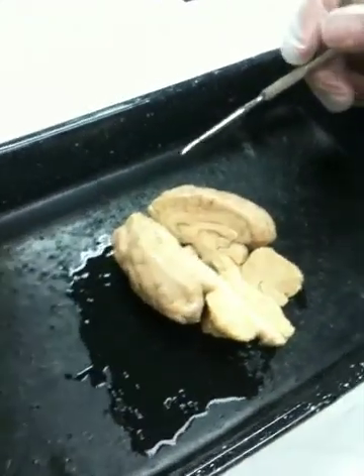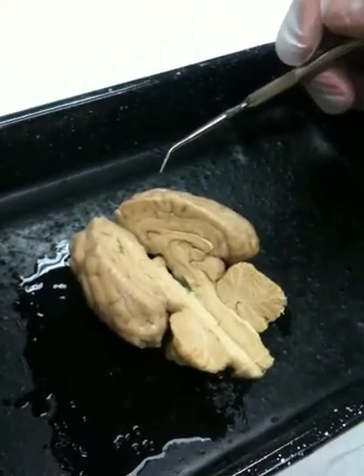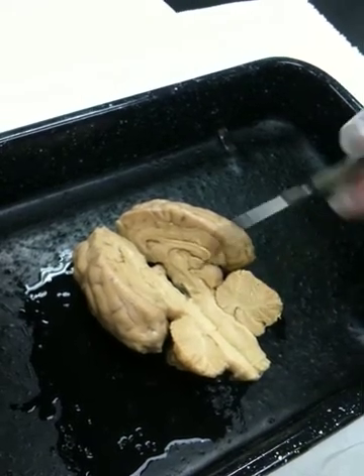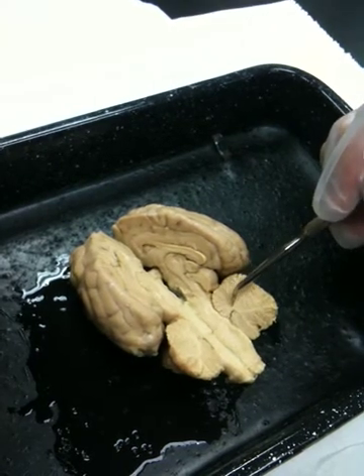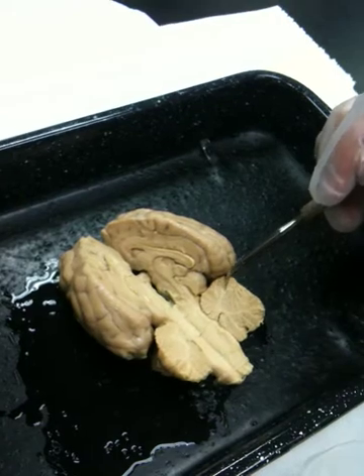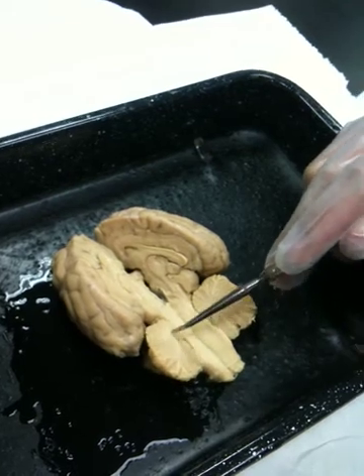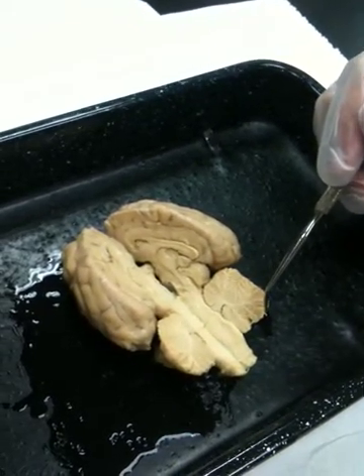Looking at the halves here, on the inside of the cerebellum in the sagittal section, we can see that there are two kinds of material. There's this darker outer gray matter, and then there's a branched pattern of white matter. The branching pattern of the white matter is called the arbor vitae. It means tree of life. Arbor vitae, the branching tree-like pattern. If we look more up into the regions of the cerebrum, I'm going to switch hands here. This one might show better what I want to look at.